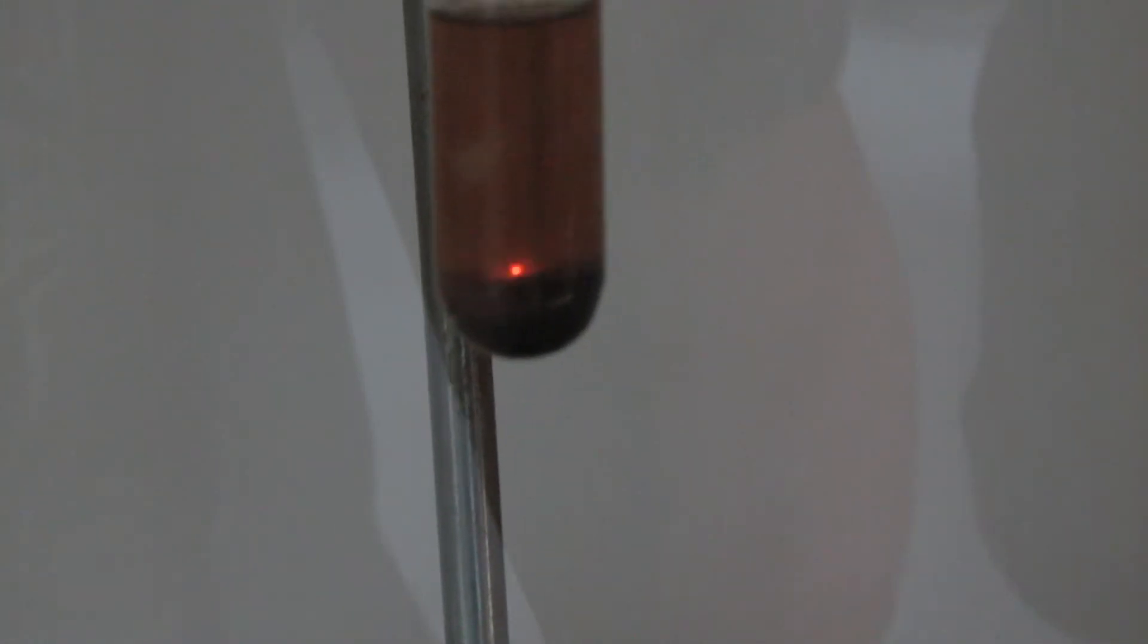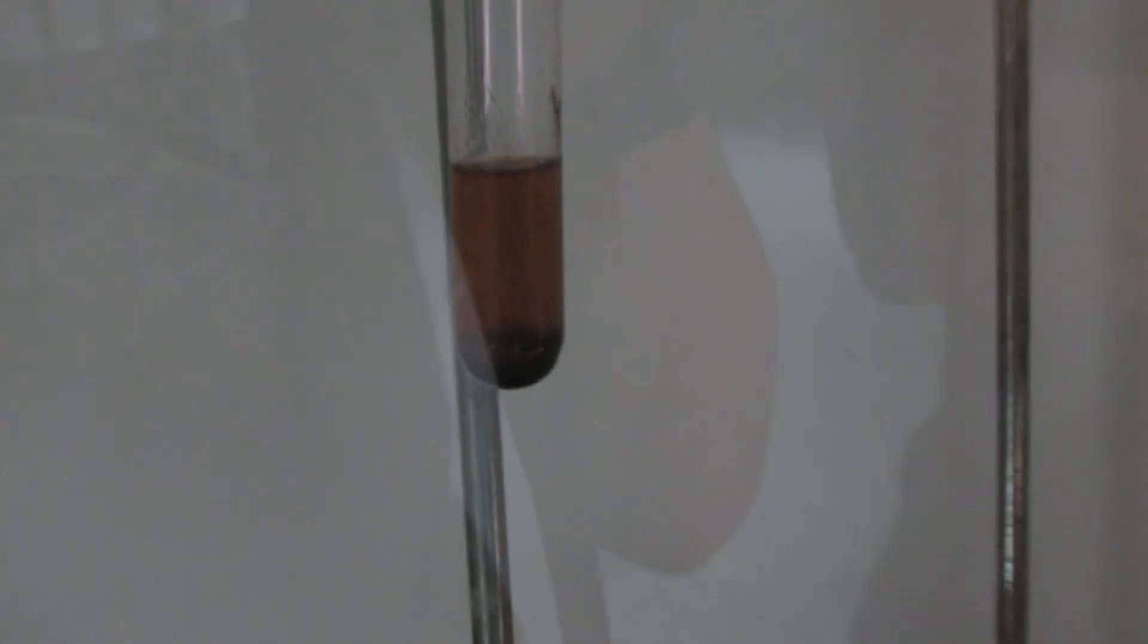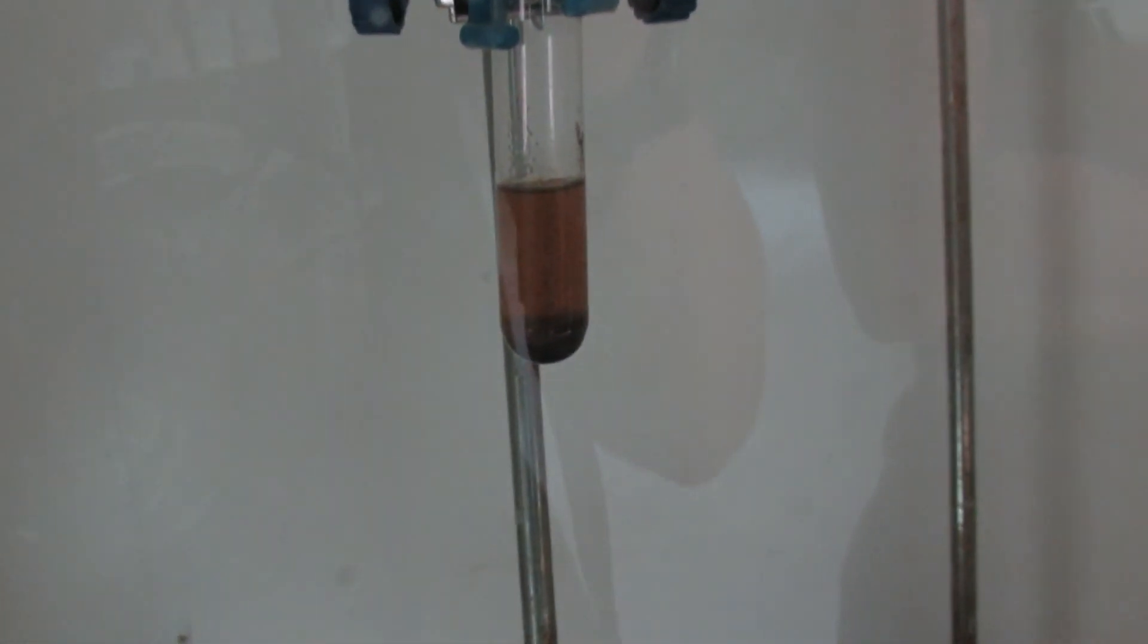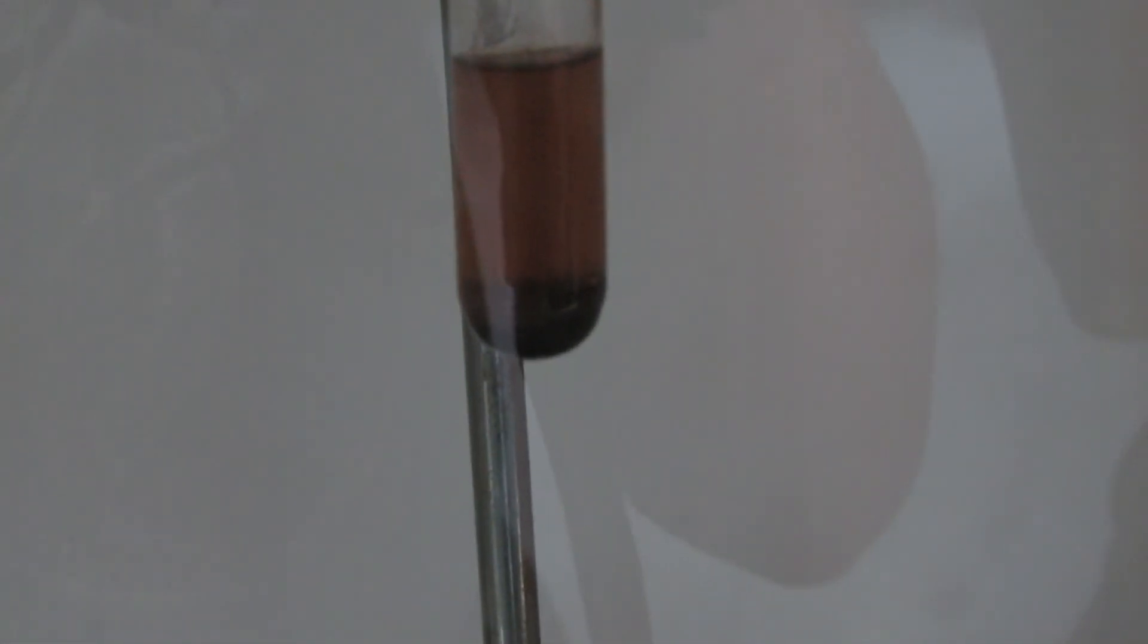It's a little tiny explosion and this could be dangerous if something went wrong, so this is behind plexiglass in my fume hood and I'm wearing goggles. I'm wearing proper safety protection.